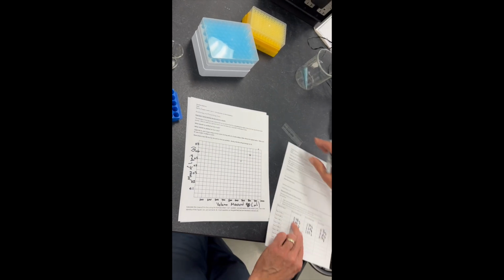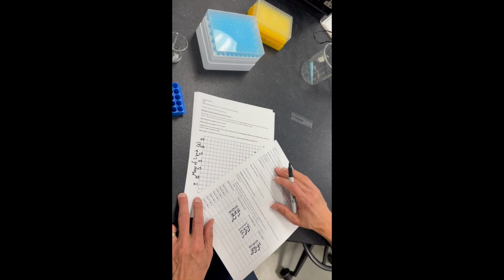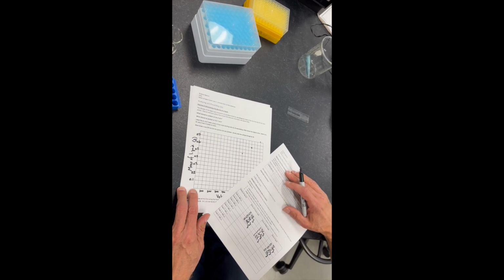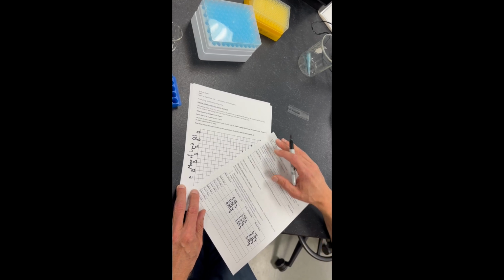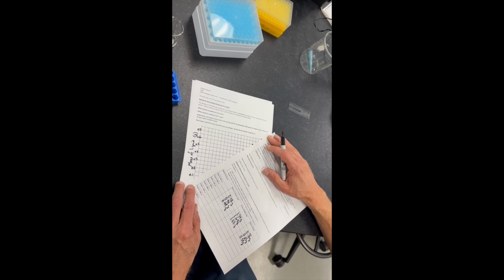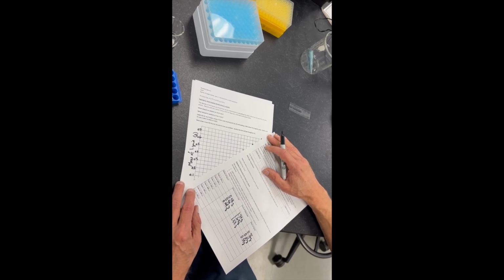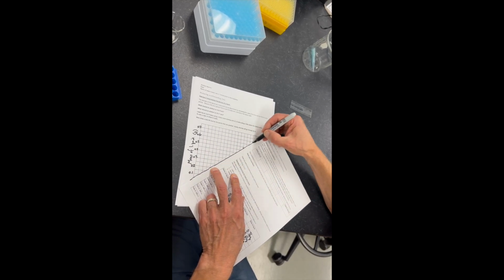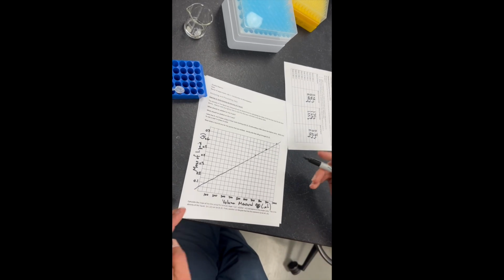Okay, so we're going to need to have a ruler, and if we weighed 0 microliters, we would expect it to weigh 0 grams. So we're going to think of that as one of our extra points. We're just going to try to get the best fit line that we can, and I'm just going to play with it a little bit. It doesn't quite go through that origin down there. Maybe I should have gone down a little bit further. But anyway, this is going to give us a chance to measure the slope of this line.